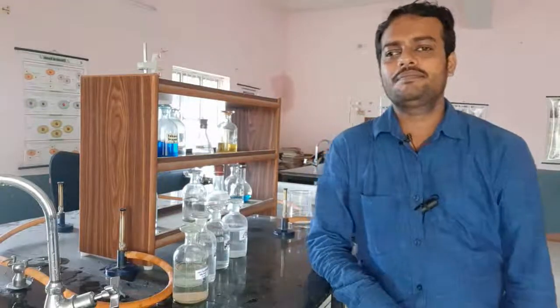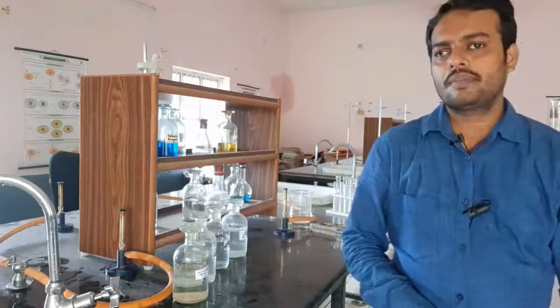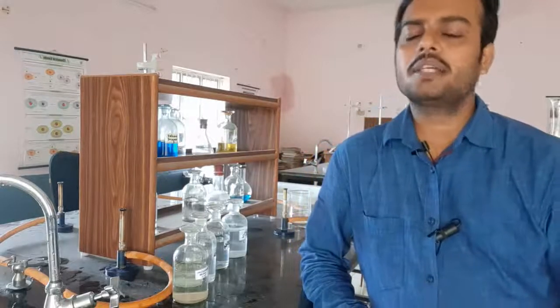Hello students. So, we are doing an experiment of class 10. We are doing the types of chemical reaction, and we are going to show you the precipitation reaction between different compounds. And you know that the precipitation reaction is a kind of double displacement reaction.